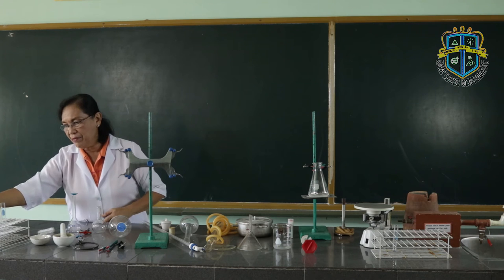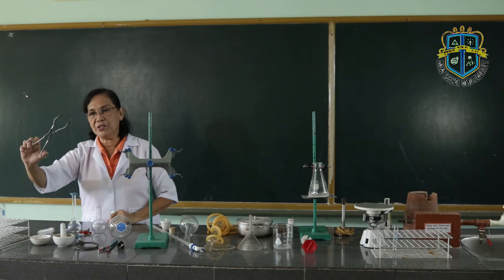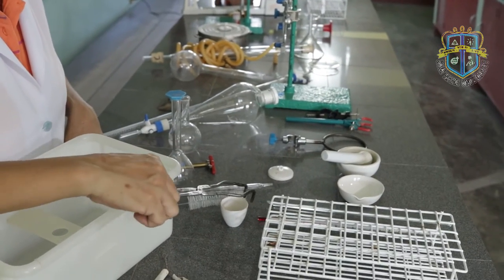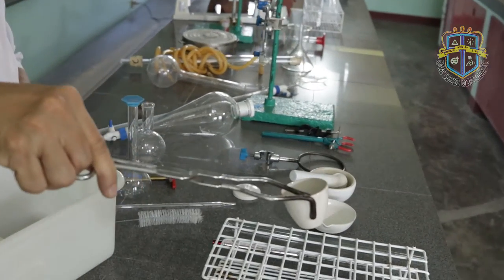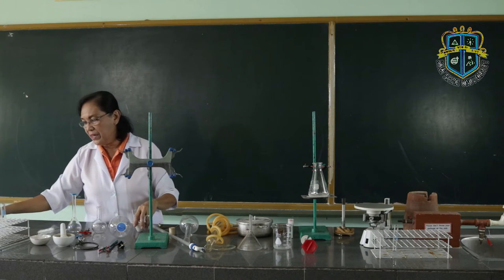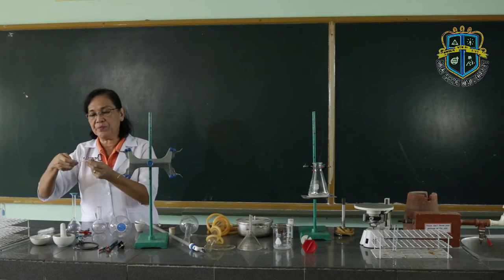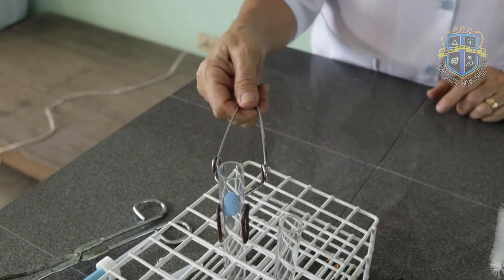Then we have the crucible tong. The crucible tong is used to hold the crucible, especially when you are going to heat the crucible. You hold the crucible this way. Then we have the test tube holder. You use it to hold the test tube when you are going to heat liquids in the test tube — of course, you hold the test tube with a test tube holder.